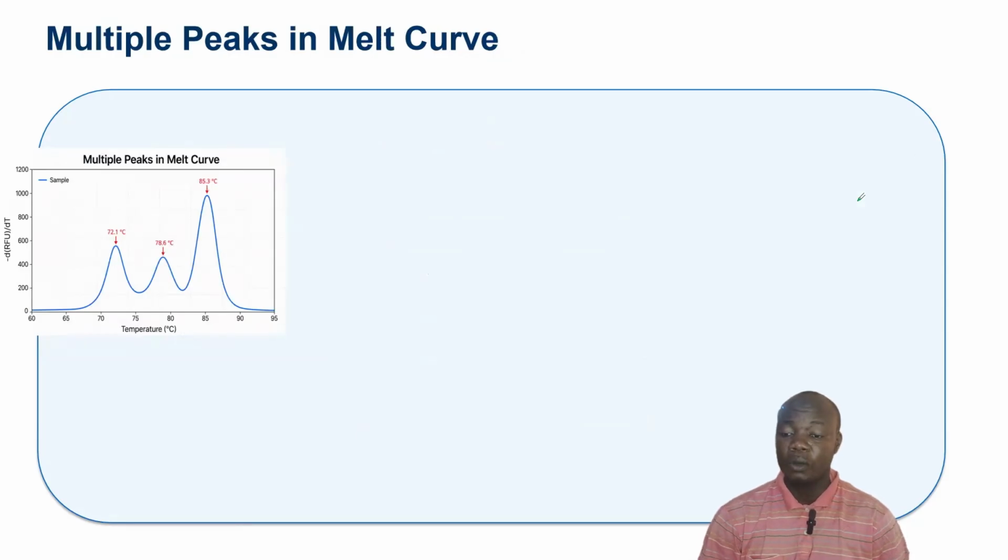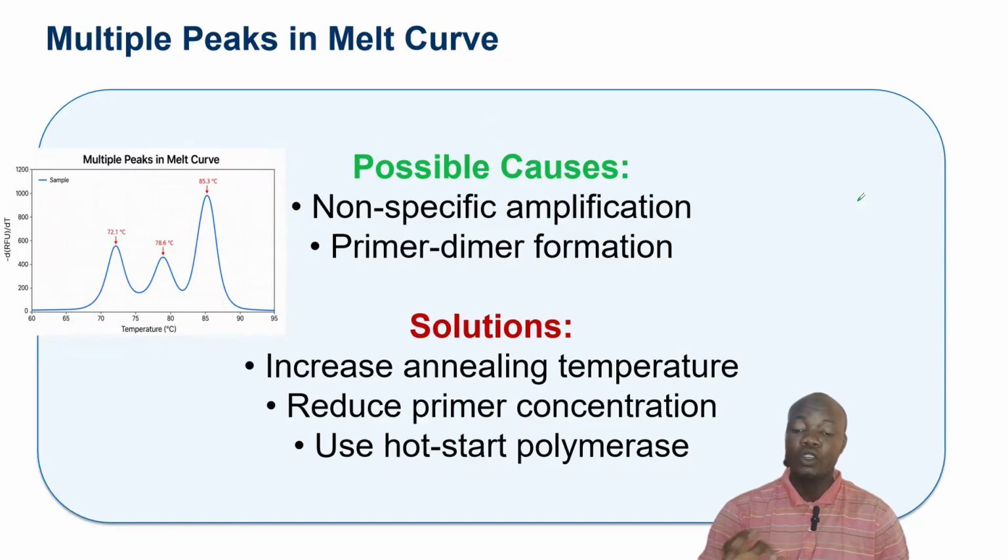Then another problem: sometimes after you carry out qPCR analysis, you generate a melt curve. If you have multiple peaks in the melt curve, it's also another problem. What are the causes of these multiple peaks in the melt curve? Number one, non-specific amplification. If there is non-specific amplification, then there is a likelihood that you are going to have multiple peaks. Or primer dimer formation. If there is a formation of primer dimer, it can also lead to multiple peaks.